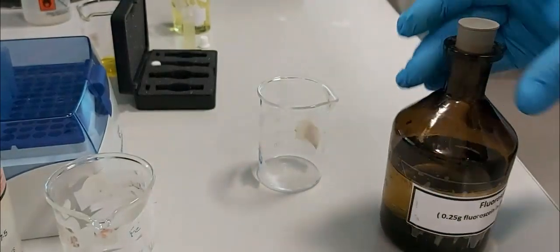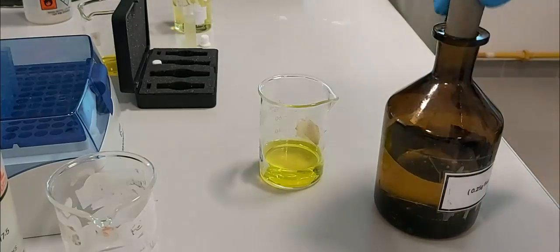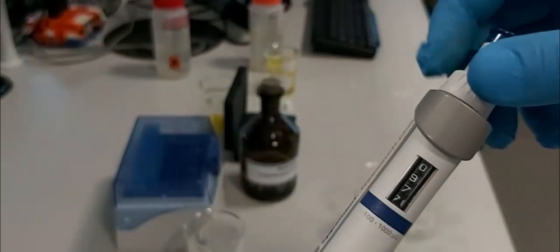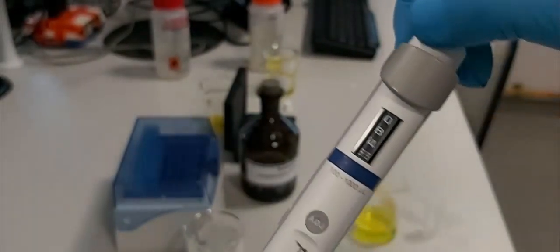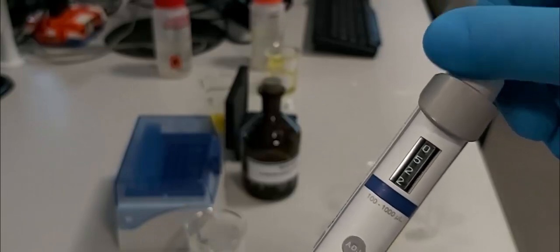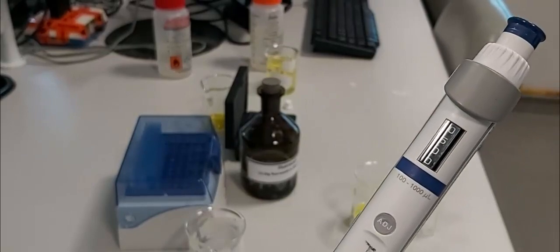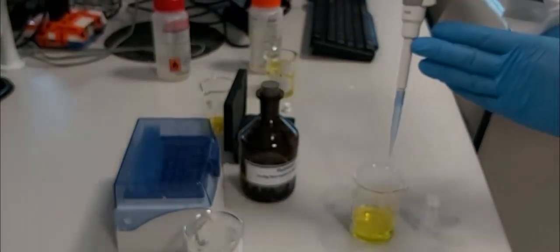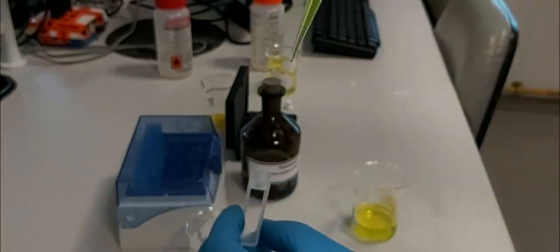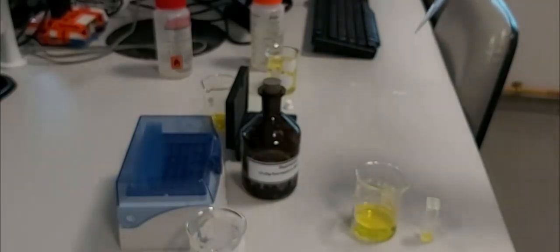Now we prepare our solution — our sample. We use fluorescein. We took a small amount in a beaker; we don't know the exact concentration. This concentration I think is too high, so we will take, using the micropipette, 0.5 mL. So we took 0.5 mL — 500 microliters — then we will put it in the cuvette. So we have 0.5 mL in the cuvette, and then we will add 3 mL of solvent.